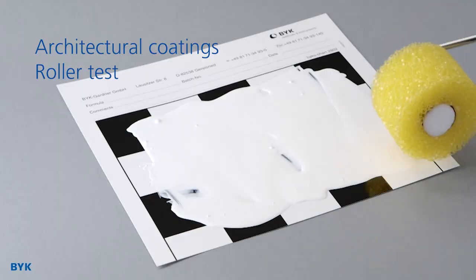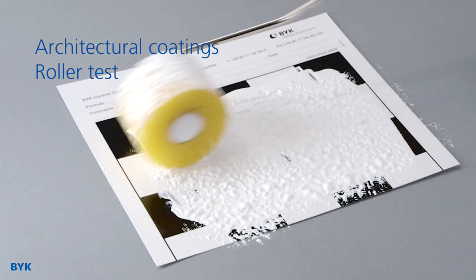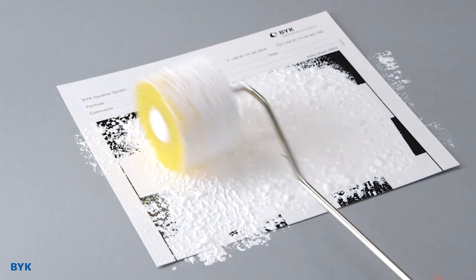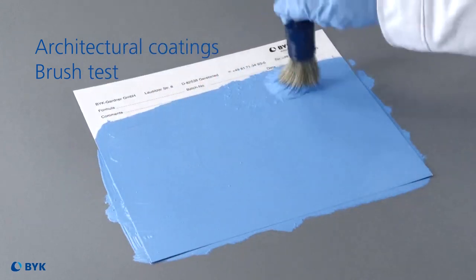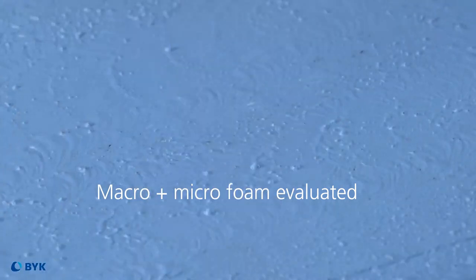What other test methods do we usually use to evaluate defoaming performance in a coating? The roller test is one of the most common test methods for evaluating defoamers in architectural paint. We create turbulence to incorporate air into the paint. Another standard defoamer evaluation test for architectural paint is the brush test. After incorporating the defoamer, half of the area is stippled by brush to incorporate more air into the system. In both methods, macro and micro foam will be evaluated.